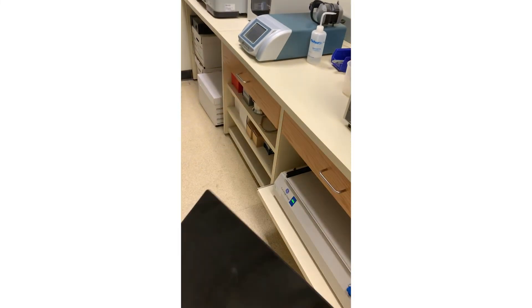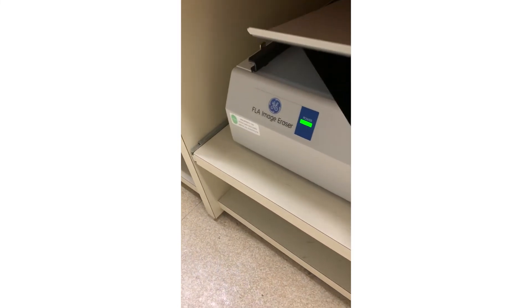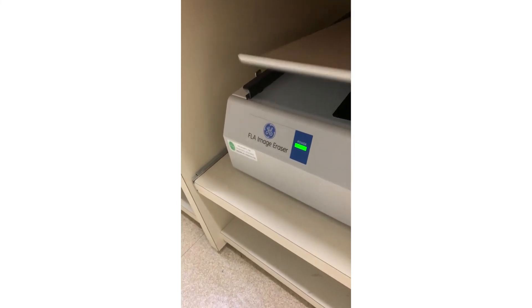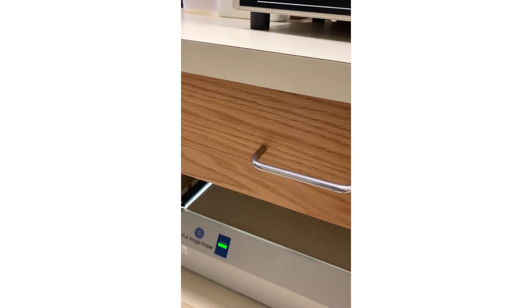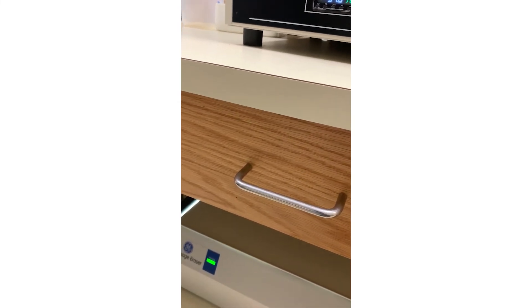To scan, I use the Typhoon scanner. I take the screen that's been exposed to my sample and stick it on the mount, which goes into the scanner. I close the door, and the laser excites the electrons trapped in the screen. When they get excited they untrap, fall back down, and release light that gets captured by a detector, amplified, and turned into a digital signal. We use software to quantify it. To reset the screen — it's like an Etch-a-Sketch — you use a light table that shines bright light and clears all the stored electrons, then store the screens in a dark drawer so they don't get accidentally exposed.